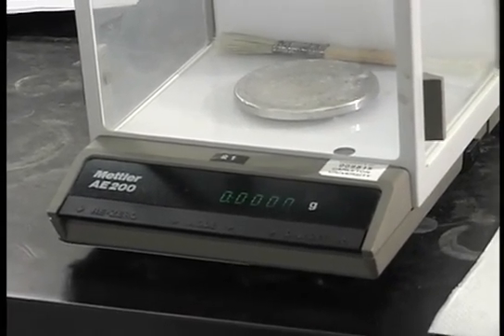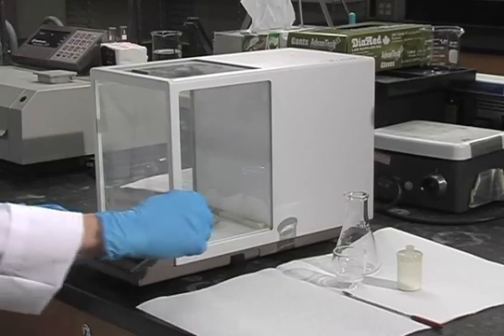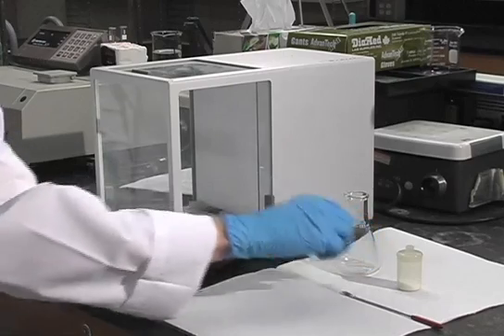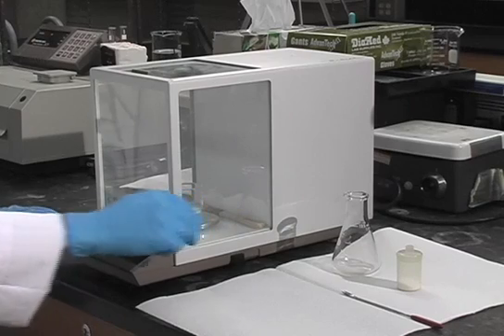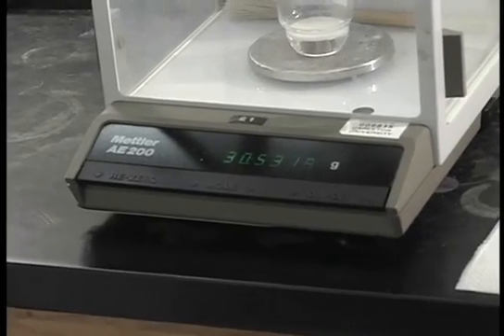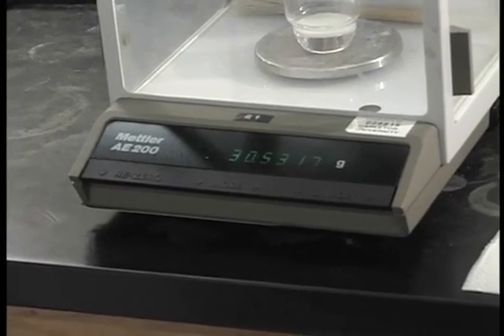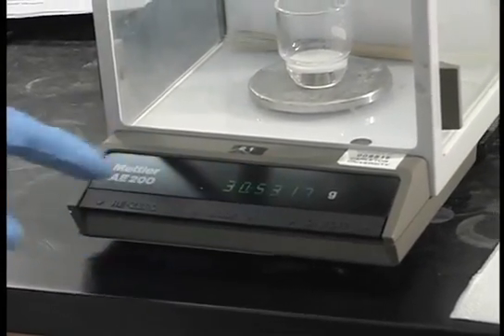There are three different ways to weigh a substance. First is just by taking the direct weight. Place it carefully on the pan, close the door, and let the reading stabilize. Then just take your weight, and make sure you take it to all four decimal places.